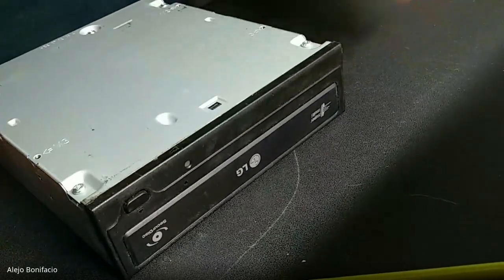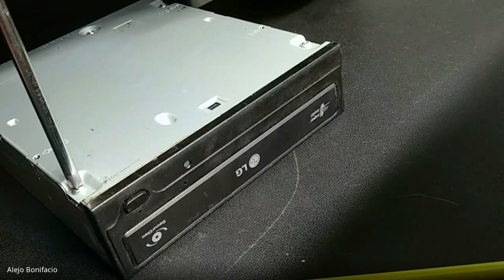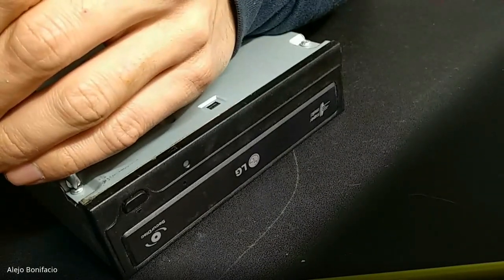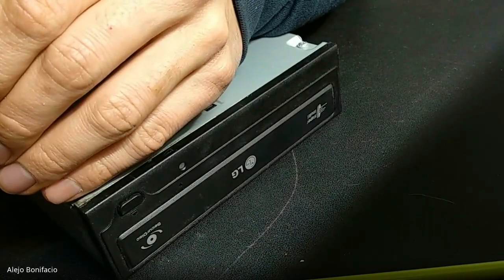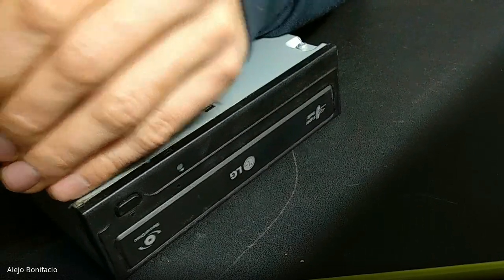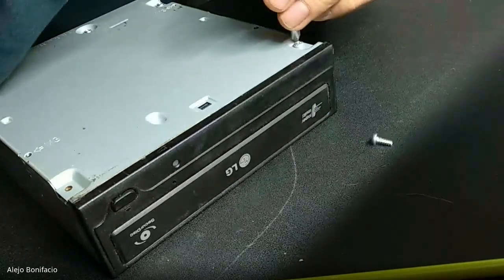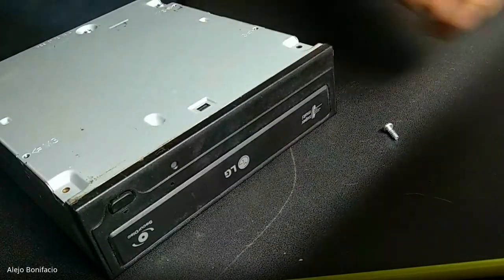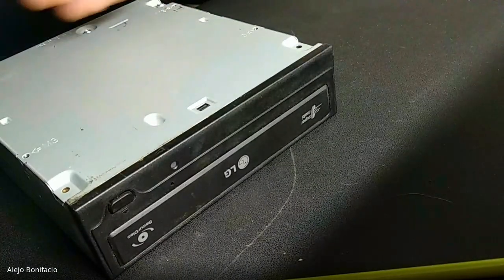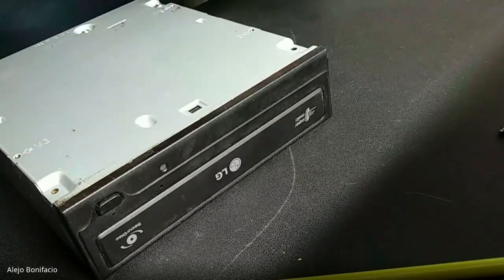The first thing to do is to take off the screws. With the screwdriver, I'm going to take off this. Screw one, screw two — those are in the lower part of this case.